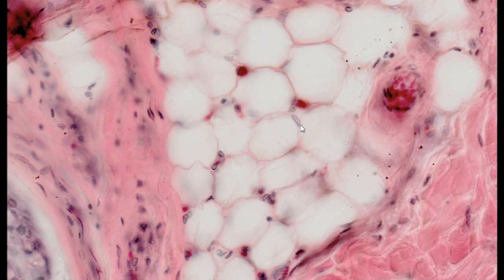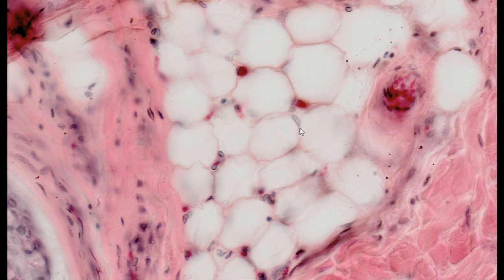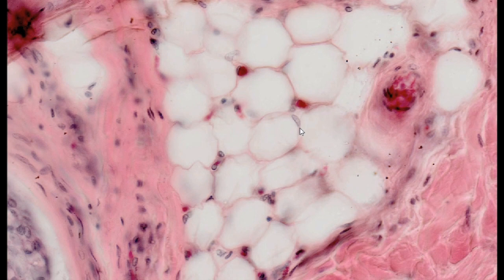Fat cell cytoplasm content is a morphological adaptation to the functions it performs. Hence, the presence of multiple mitochondria and a well-developed smooth endoplasmic reticulum.